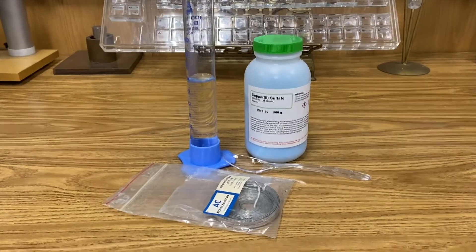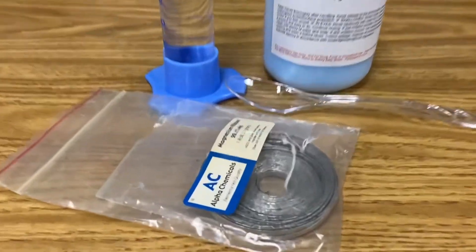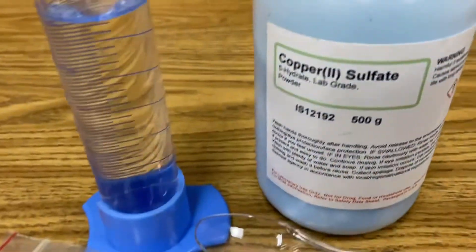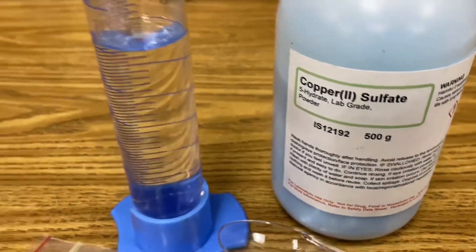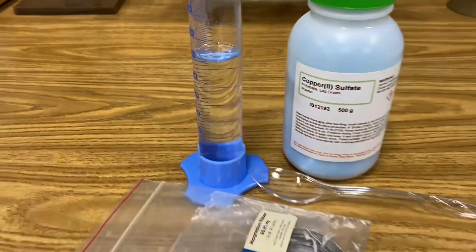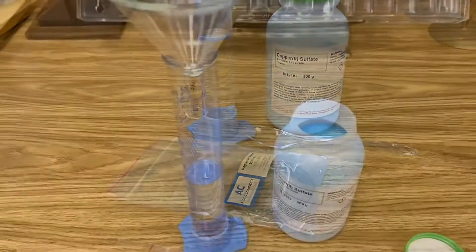All you need for this lab is of course some magnesium, copper 2 sulfate, some distilled water, and a graduated cylinder.